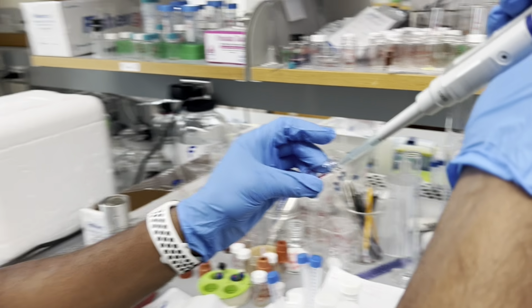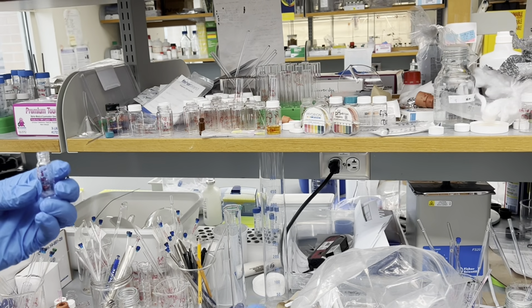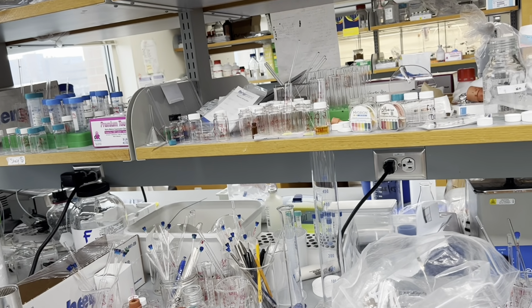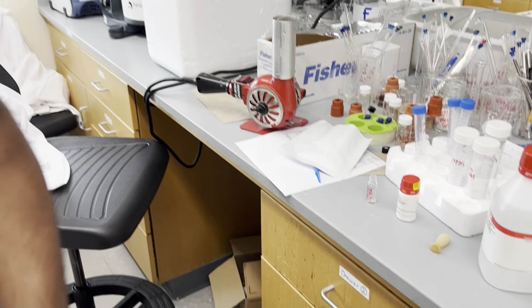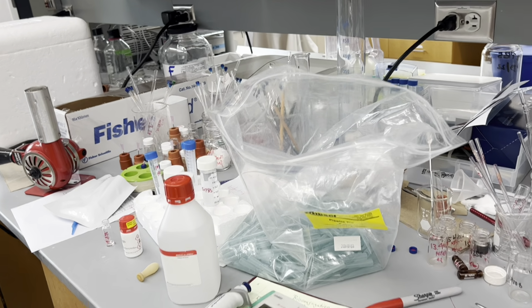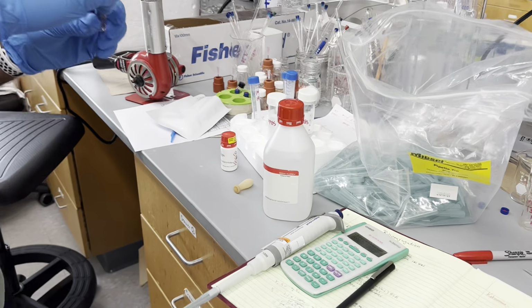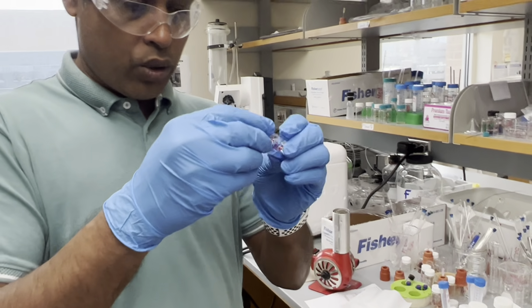What is slowly, anyways? How much acid will we add at a time? The HCl. Are we not going to be using up some of our compound? A little bit. It's negligible, only a small amount. That's why we are not using too much.